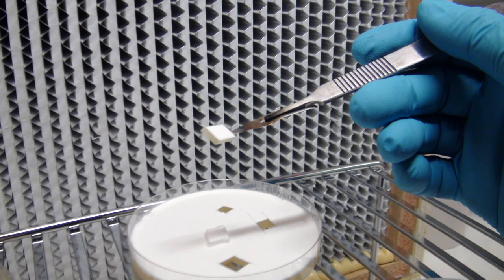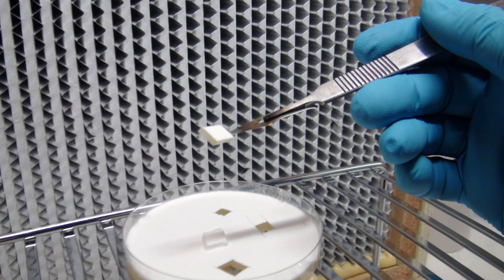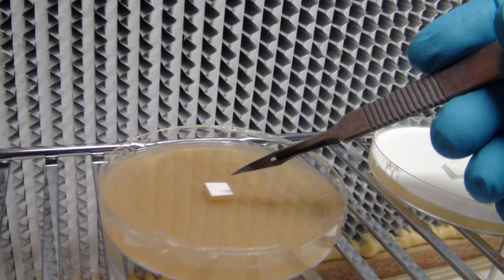Transferring cultures is a pretty simple process. All you need to do is get a fresh agar dish and your original petri dish or culture slant and use a sterilized blade to cut out a piece of mycelium and transfer it over to the new dish.